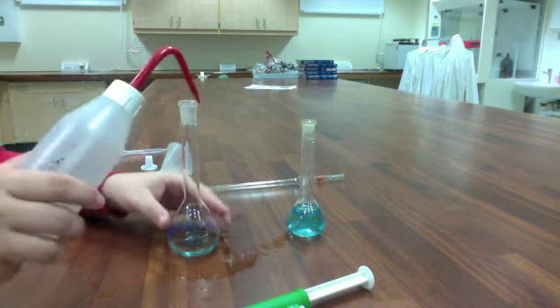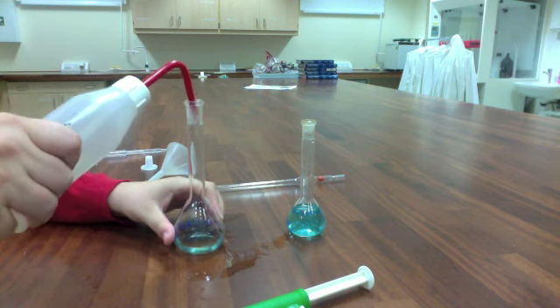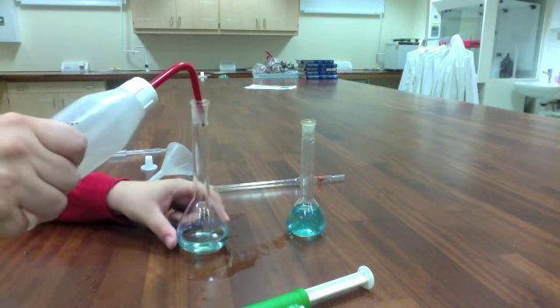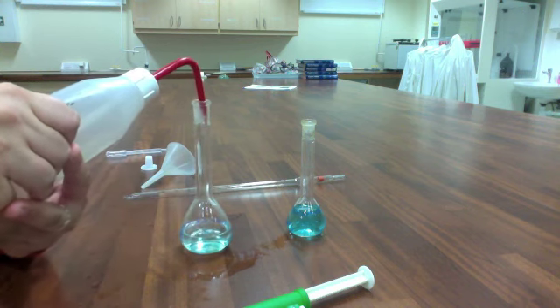And then, just like we did before, you are going to add distilled water. Making sure that this is distilled and not tap—I don't think I mentioned that last time. Add distilled water to make this solution up to the mark.